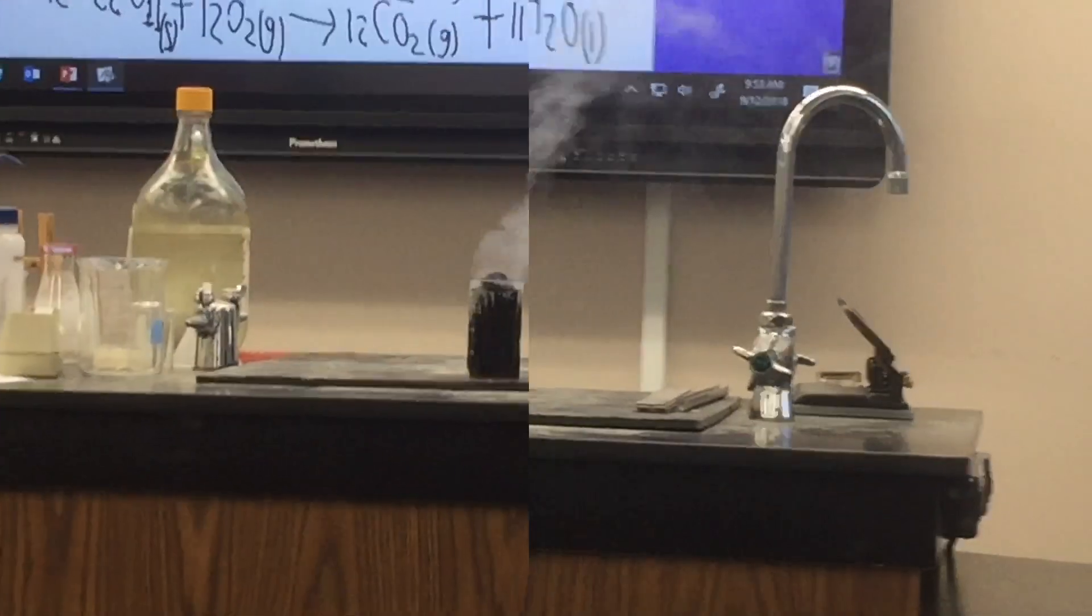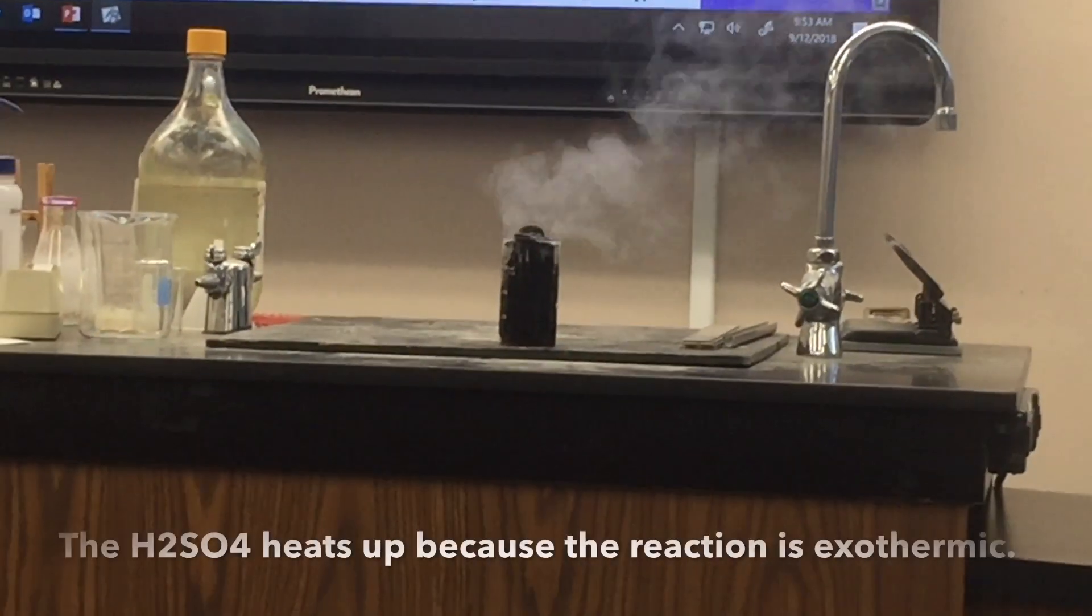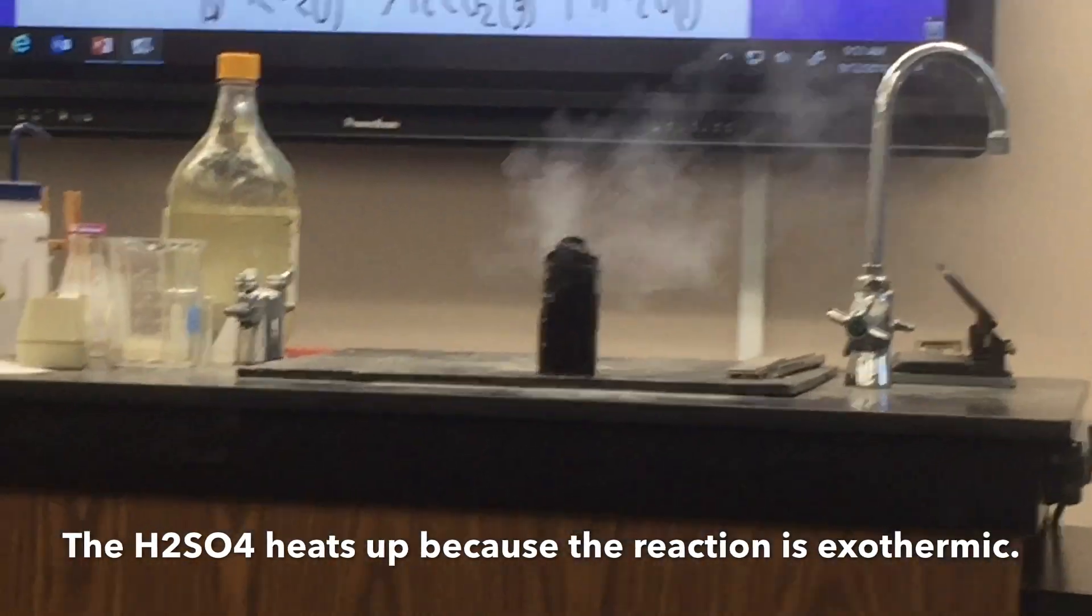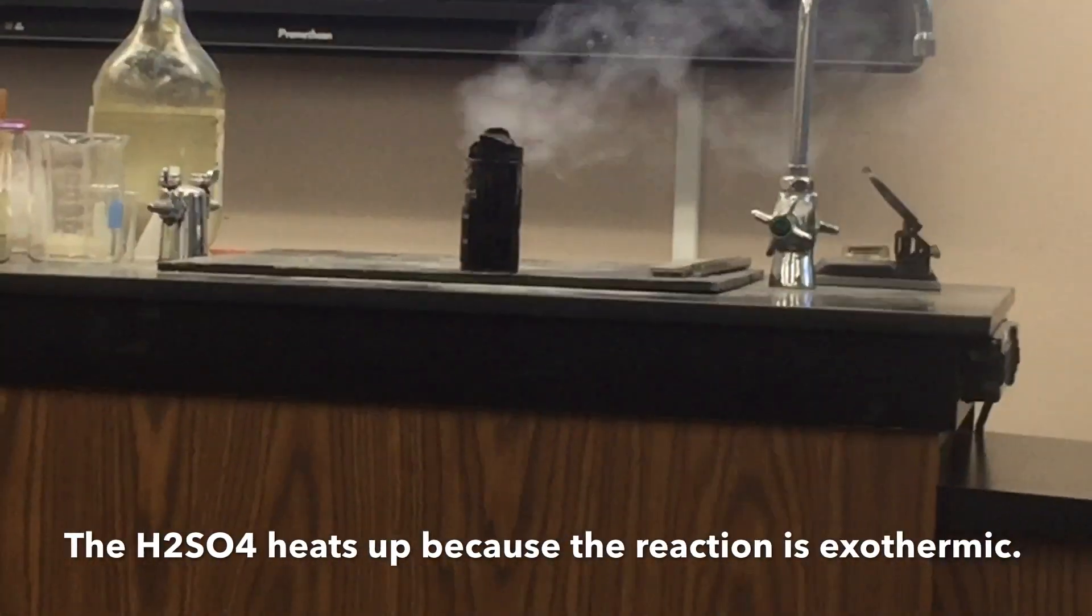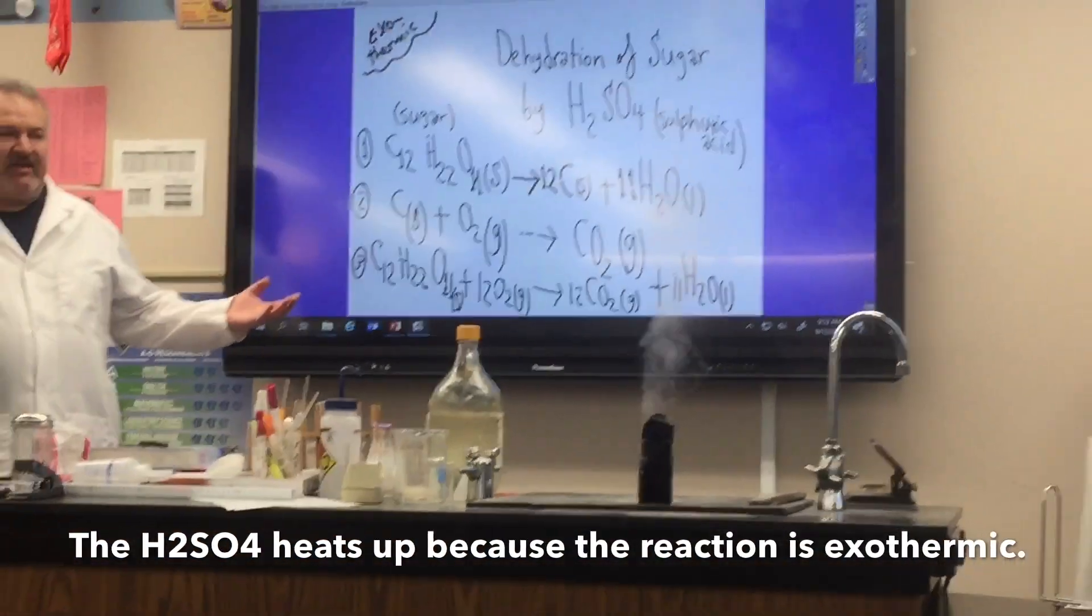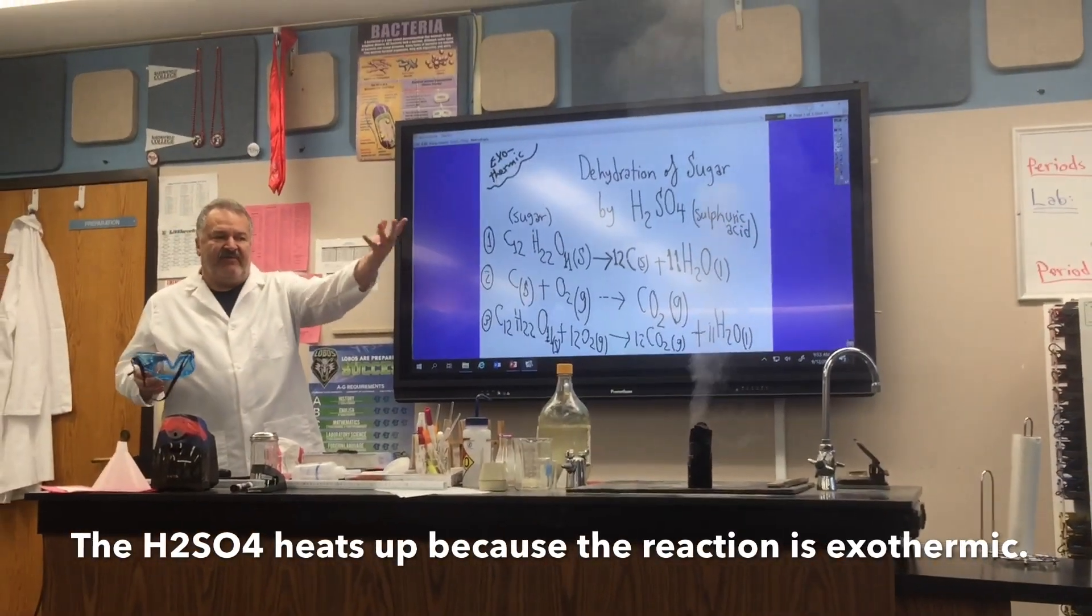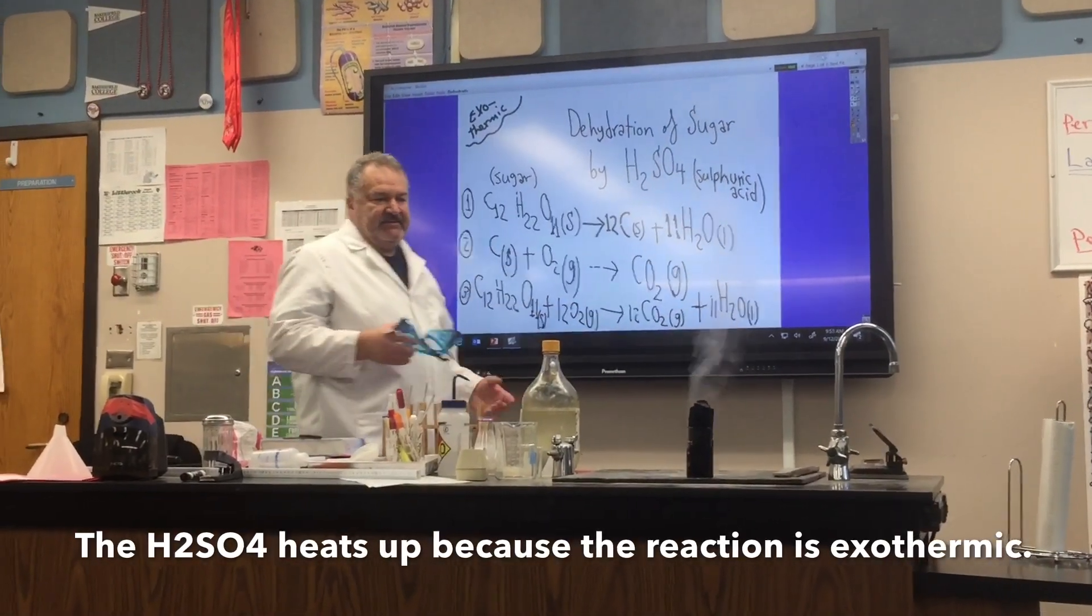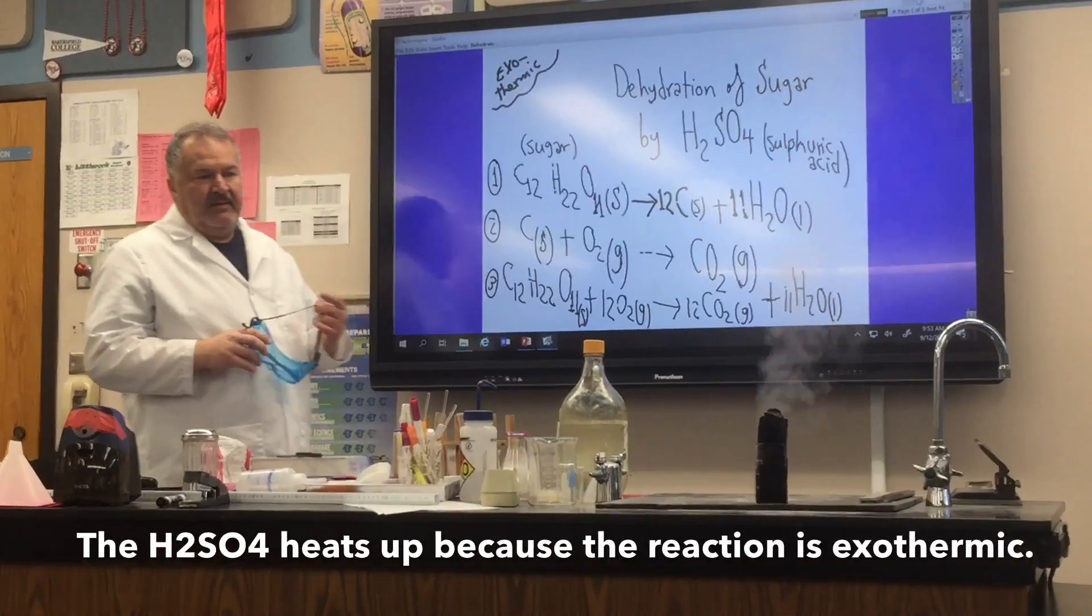What do you think? What kind of product you got out there? Carbon. This is the carbon. Carbon is reacting with oxygen, forming carbon dioxide. So the final product basically is steam, vapor of water, and carbon dioxide.